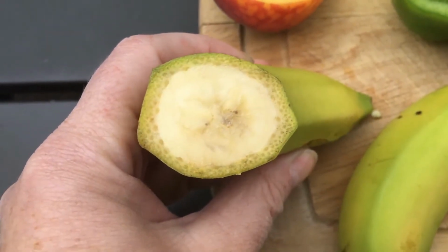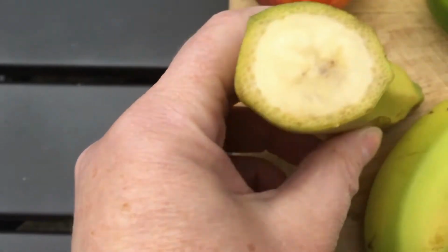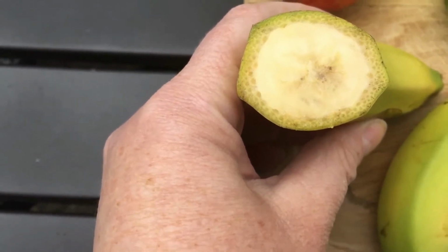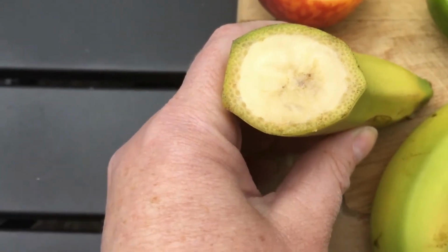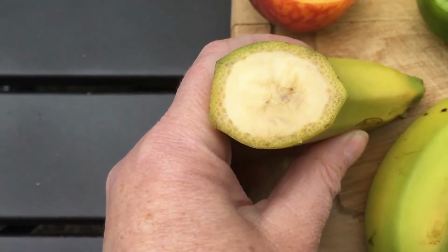So, many seeds. This one would have at least 3 seeds. You can kind of see the threefold division in there. Of course, the bananas you buy in the grocery store don't really have true seeds. They won't grow from seeds anymore. They are vegetatively propagated. But you can see the little black specks are the remnants of the seeds that would have been in there. So that's a type of berry.